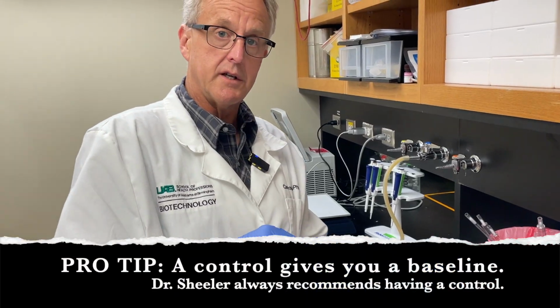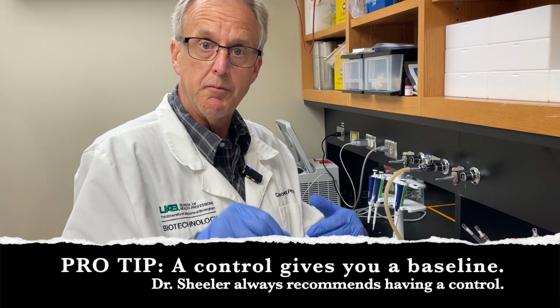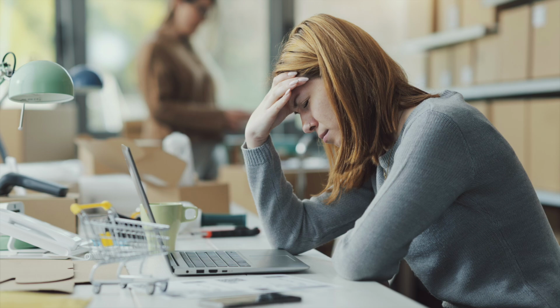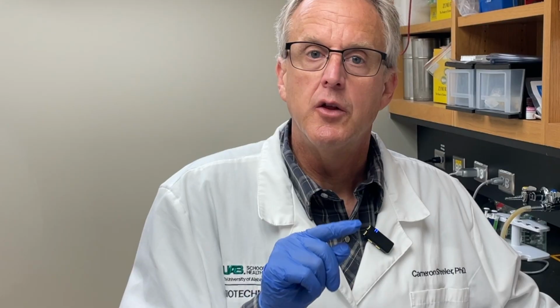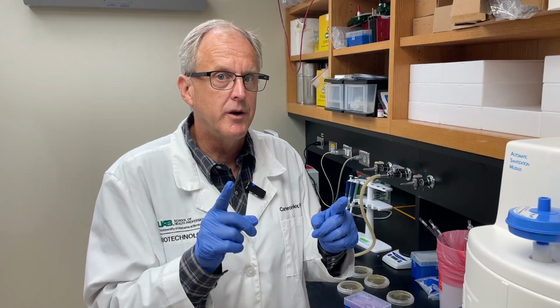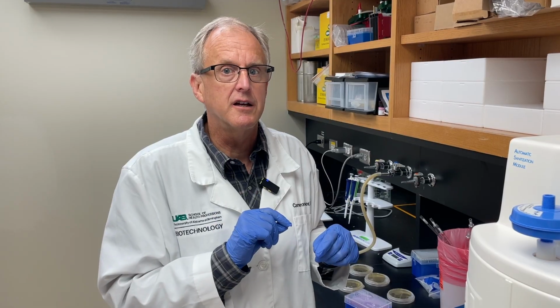I'm going to use this as a control, or if you wanted to use this also, we can actually add plasmid to this. Here's your homework. What will happen to that bacteria that does not have the plasmid? And I plate it on a plate that has a selection, kanamycin. What do you think is going to happen? We'll find out as our saga continues.